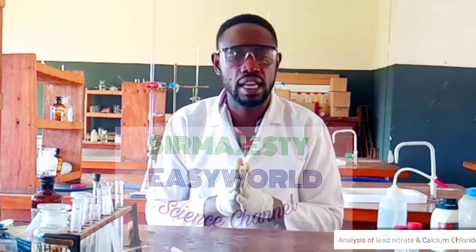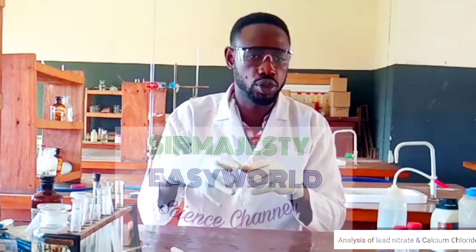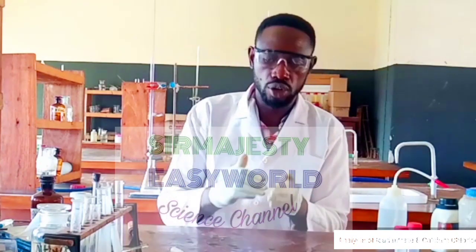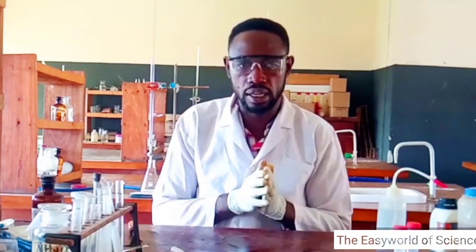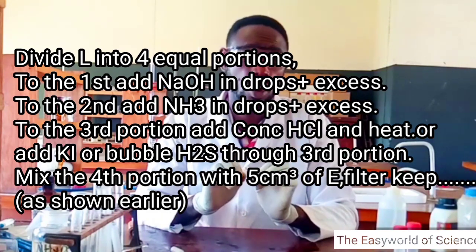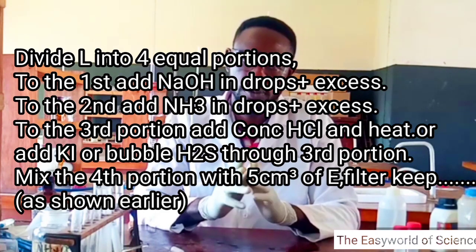Which means with sodium hydroxide and aqueous ammonia, you cannot clearly distinguish between lead and aluminium, since both of them will be soluble in excess sodium hydroxide and remain insoluble in excess aqueous ammonia. So, what do we do? There should be another step to distinguish the two. And there are three things that we use to distinguish between lead and aluminium, and these things are conc HCl, then potassium iodide, and hydrogen sulfide. Just watch the video on distinguishing between aluminium and lead here on this channel.